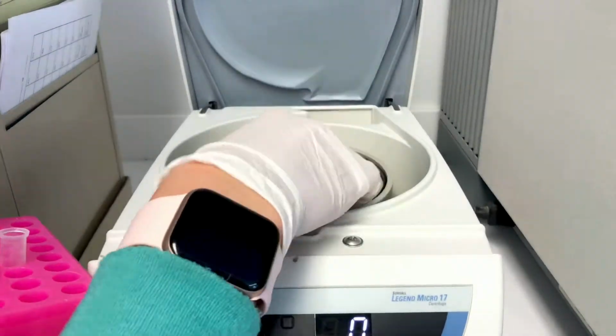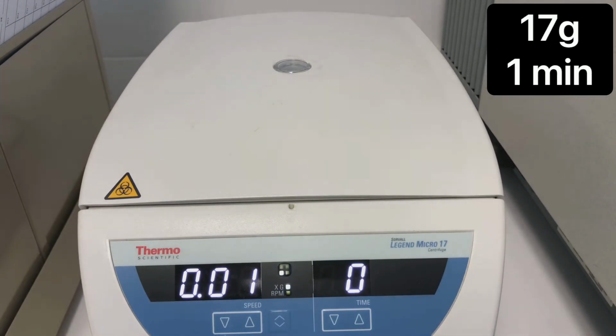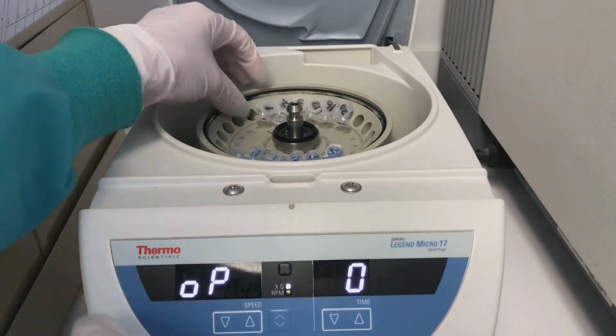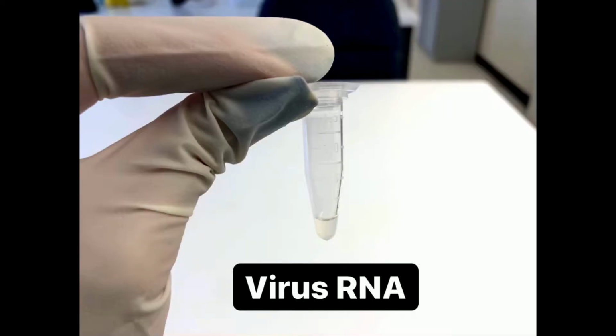Load your tubes in the microcentrifuge and spin for 0.2 Gs for 2 minutes. Then spin your tubes for 17 Gs for 1 minute. When the final spin is complete, you may discard your spin column. And the final product is your RNA extraction.